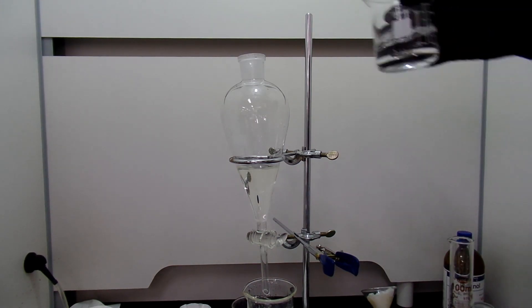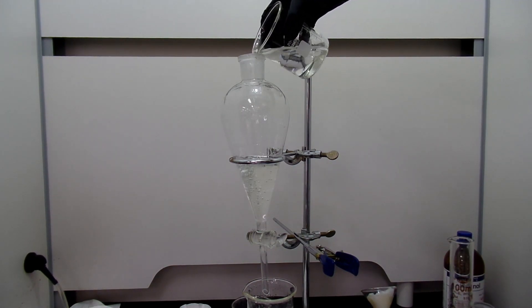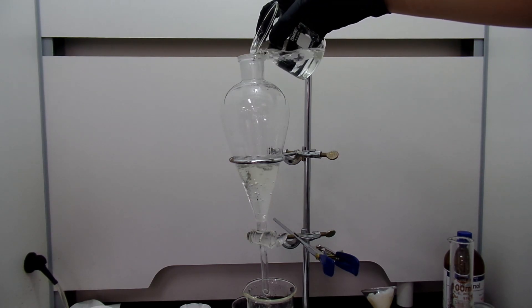Then I added DCM to extract benzyl alcohol. It gets quite a lot of pressure inside, so the separatory funnel must be vented frequently.